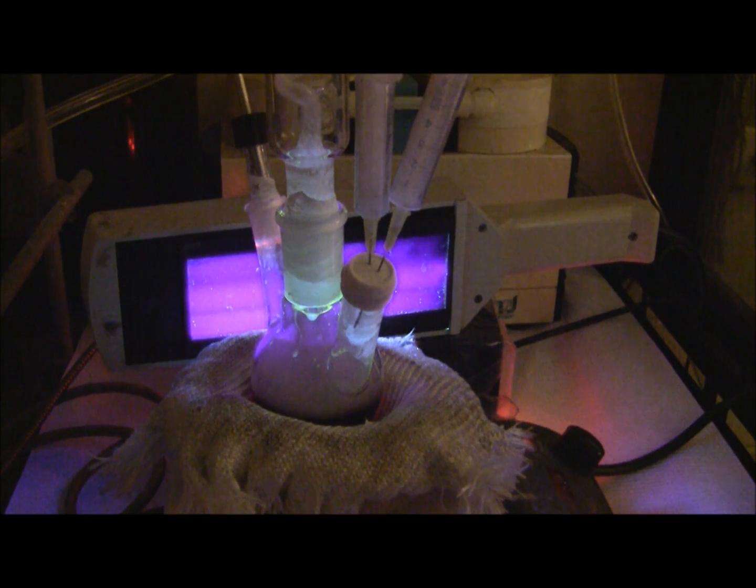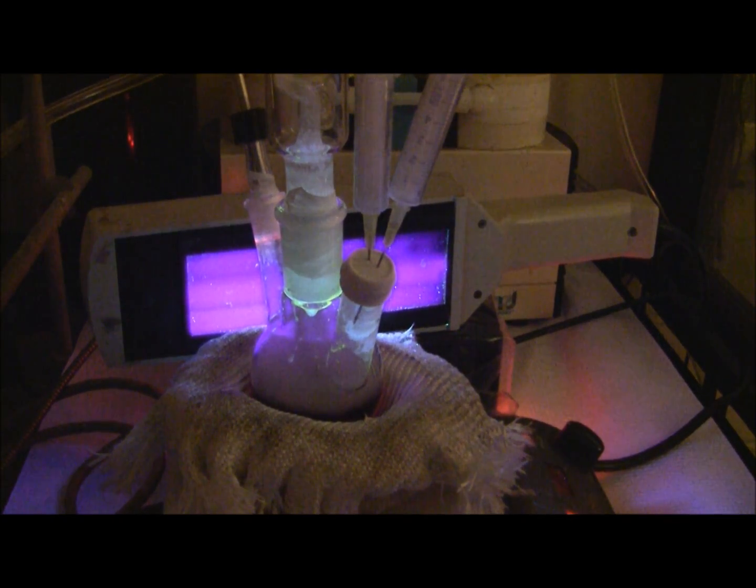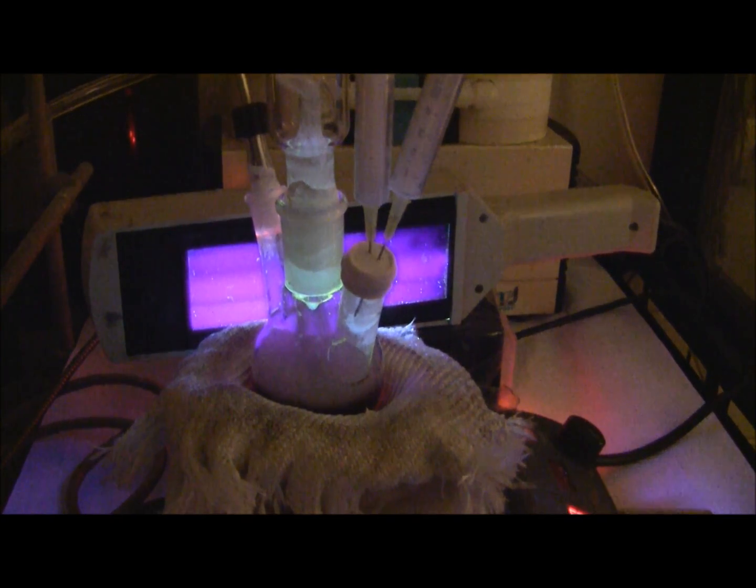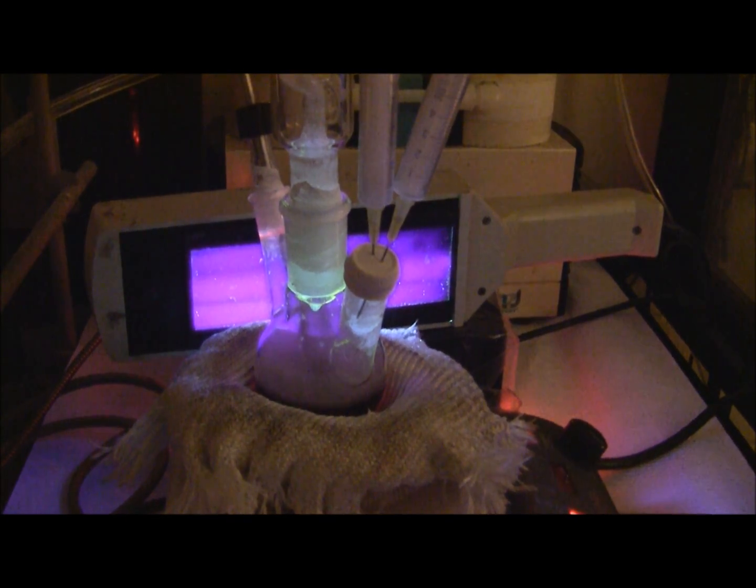So that's as the particles are growing. The color of the quantum dots shifts from green to red.